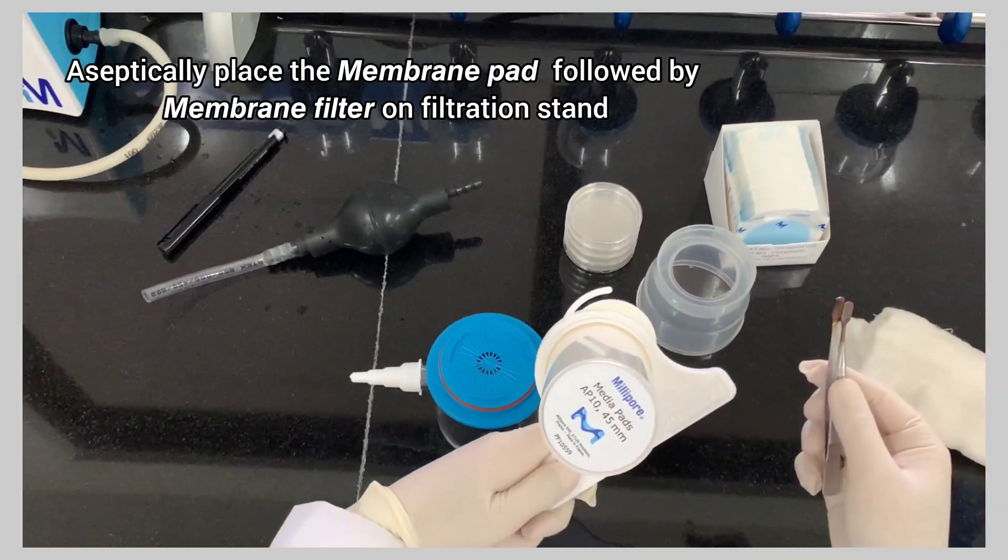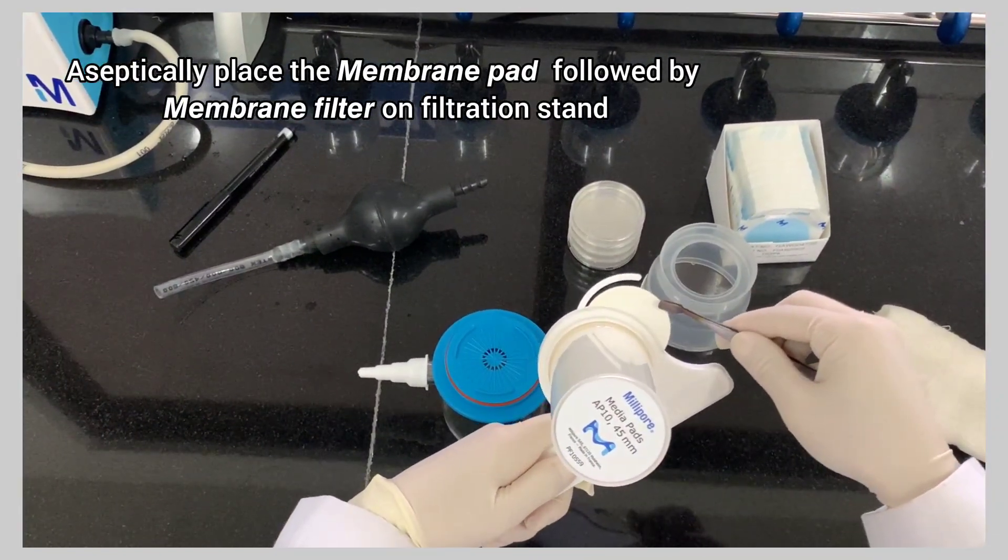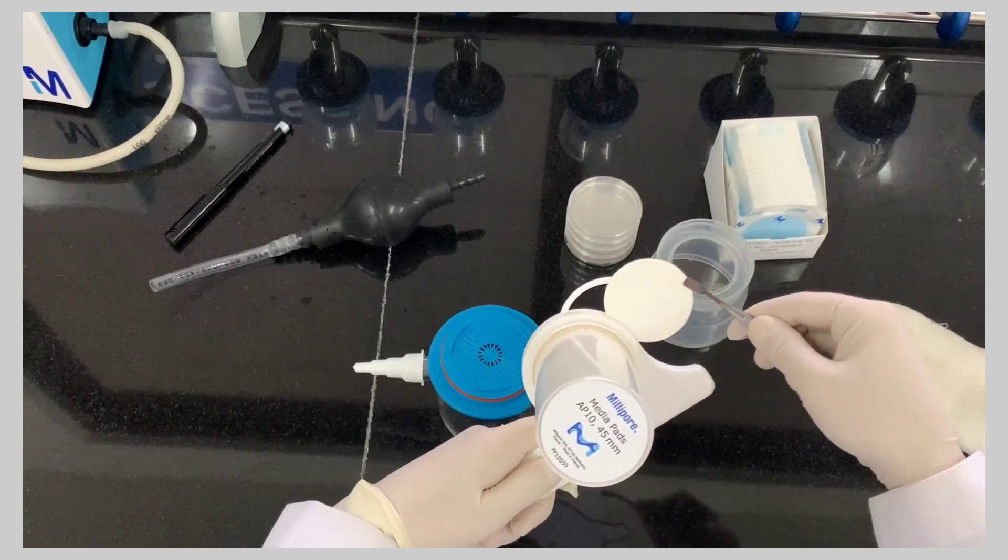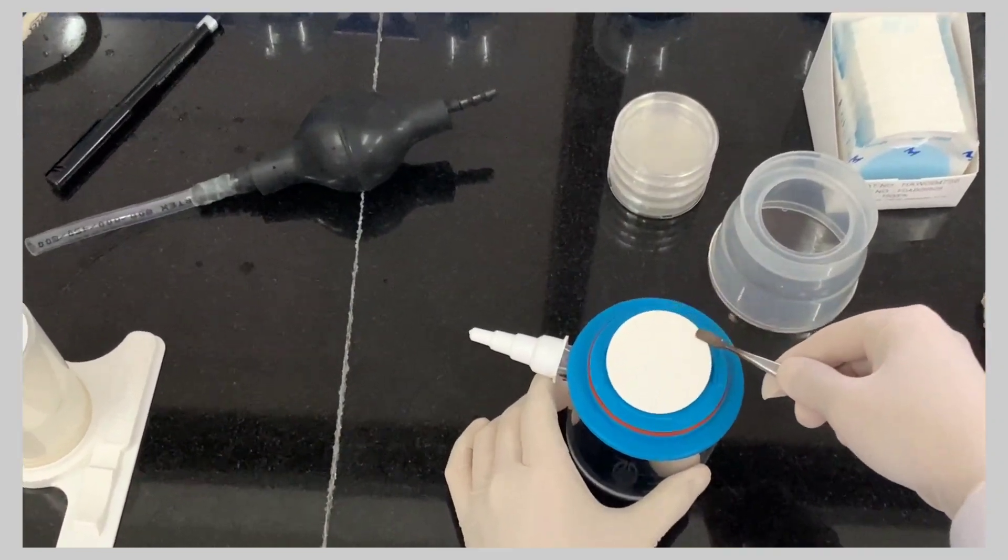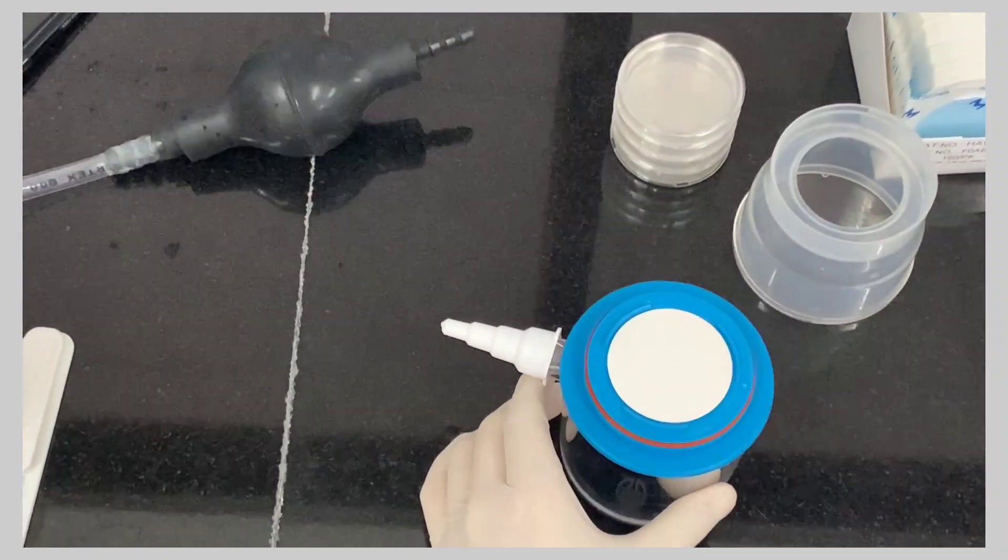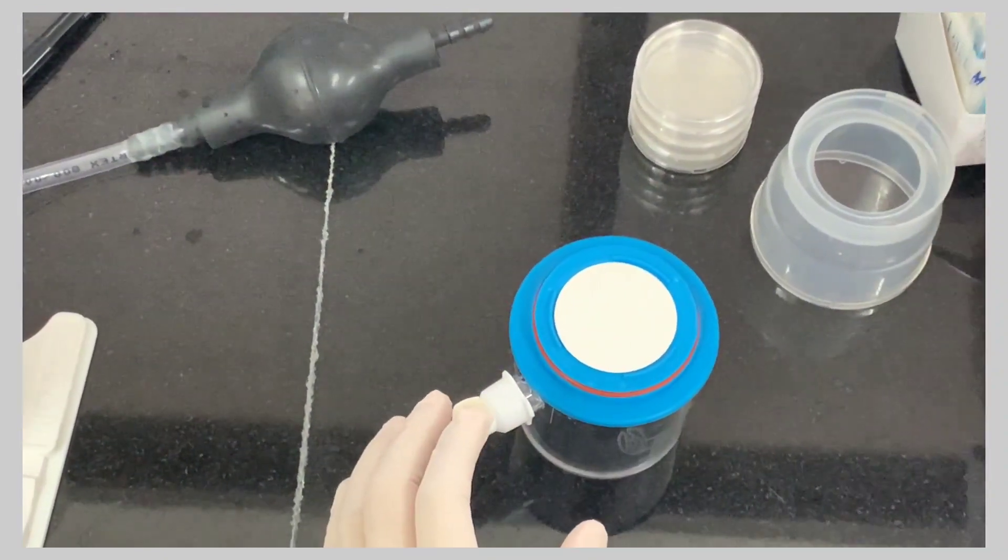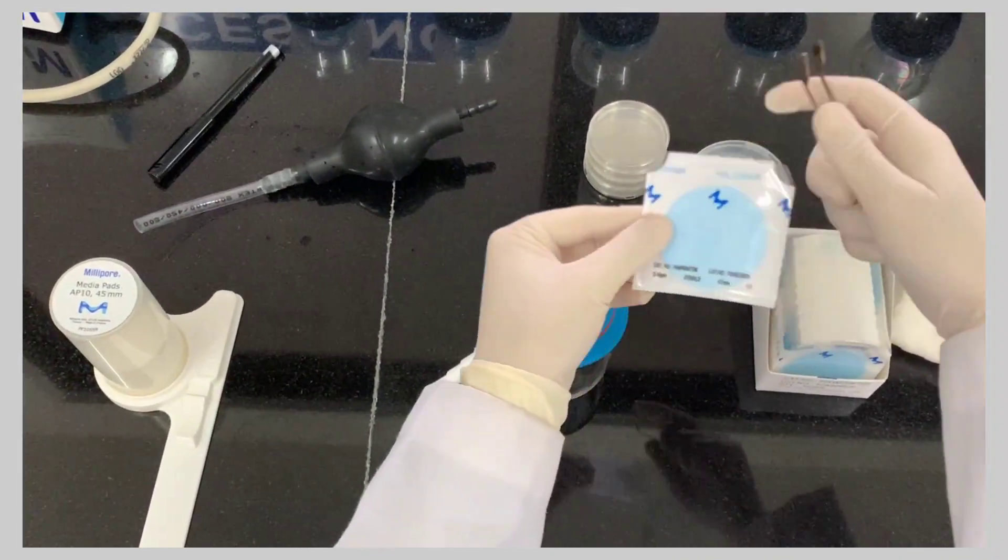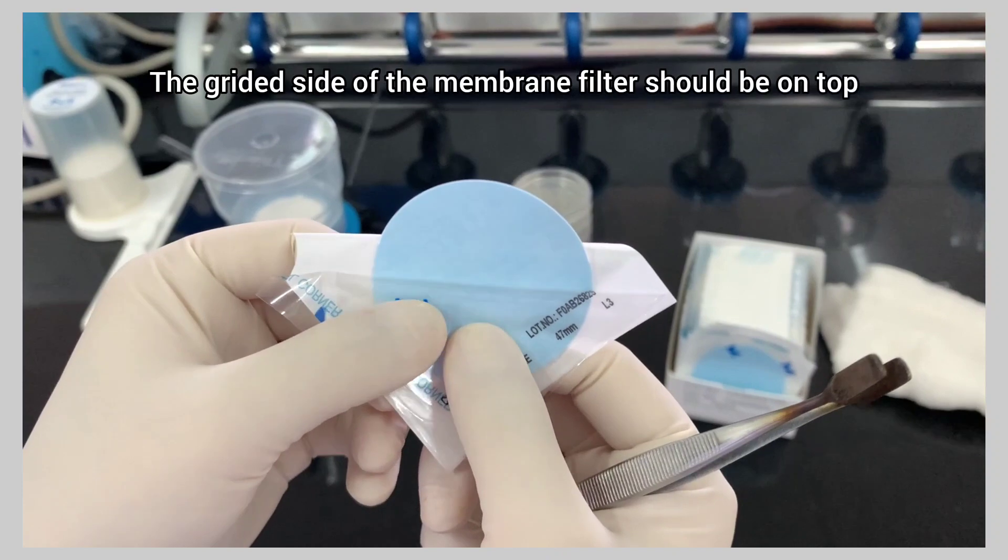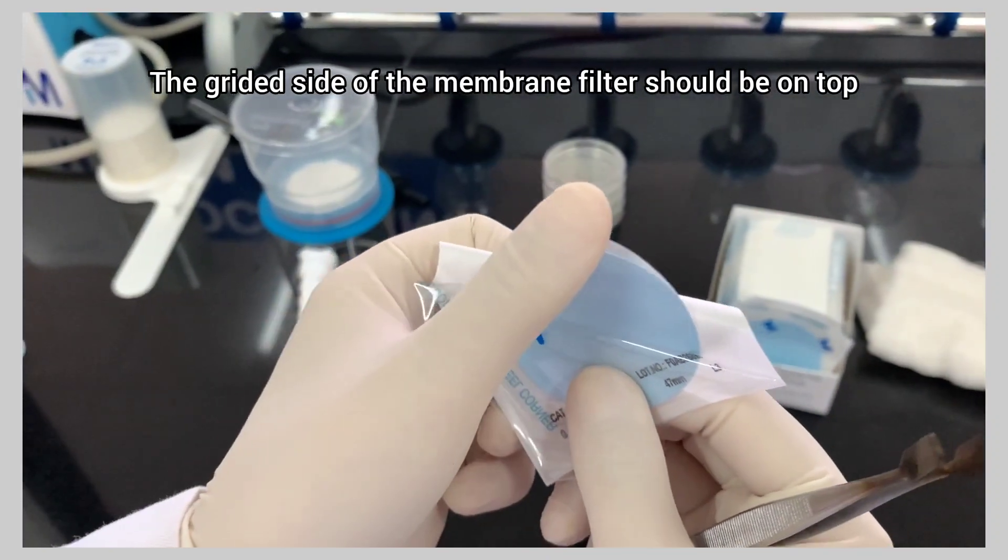Aseptically, place the membrane pad followed by membrane filter on filtration stand. The gridded side of the membrane filter should be on top.